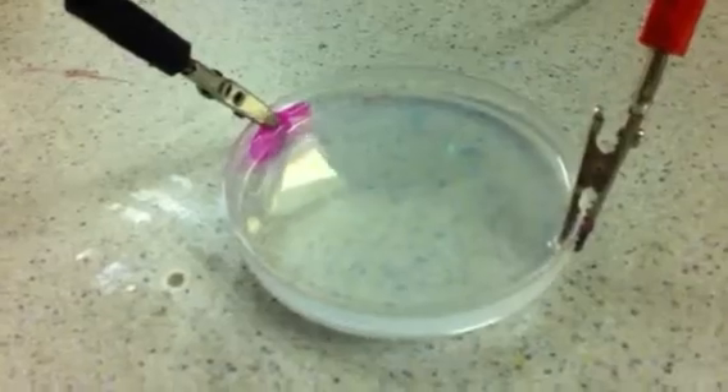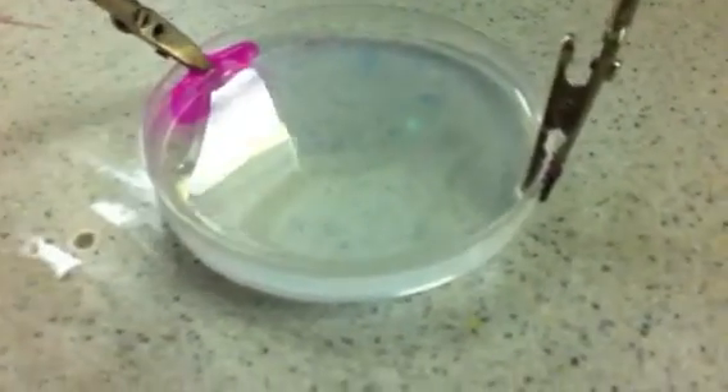No, it didn't take any longer. Right, it was pretty much straight on. See if I can use that. Right, let's create another lovely swirl.